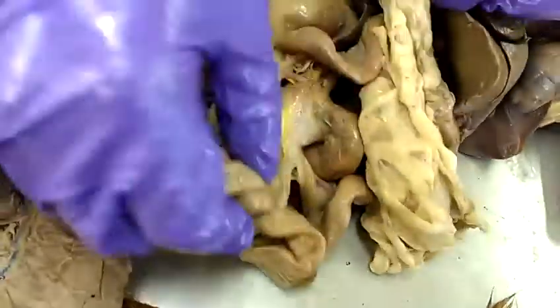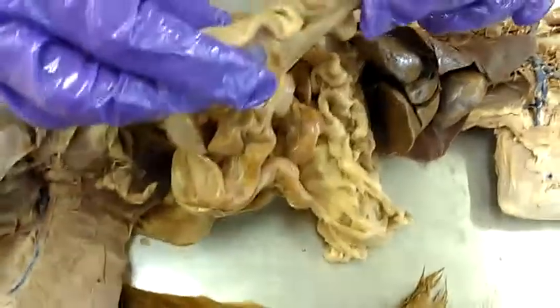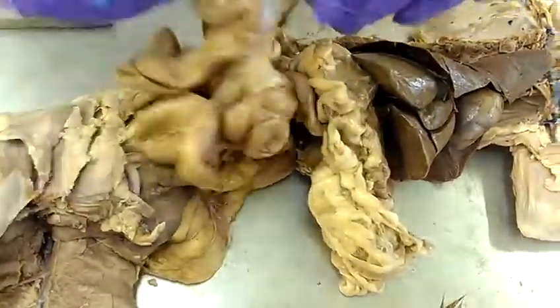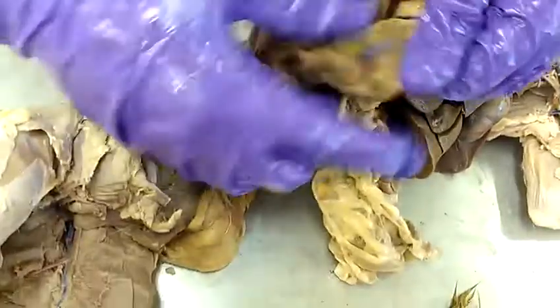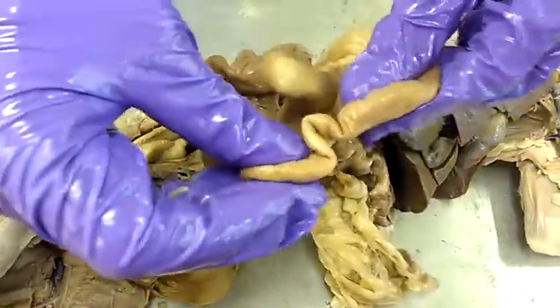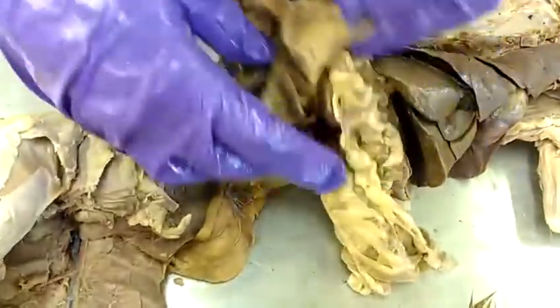Duodenum — it's hard to see. Jejunum — this is all small intestine. And that's the mesentery. Ileum, which connects into the large intestine.